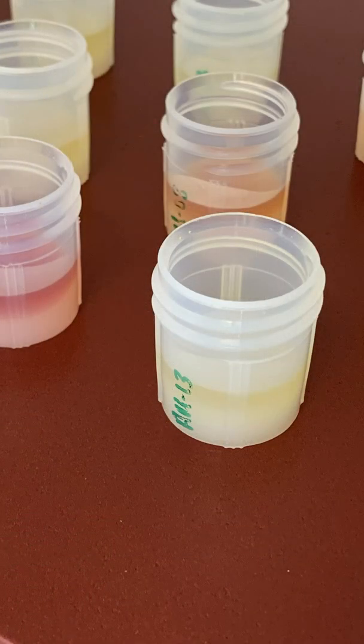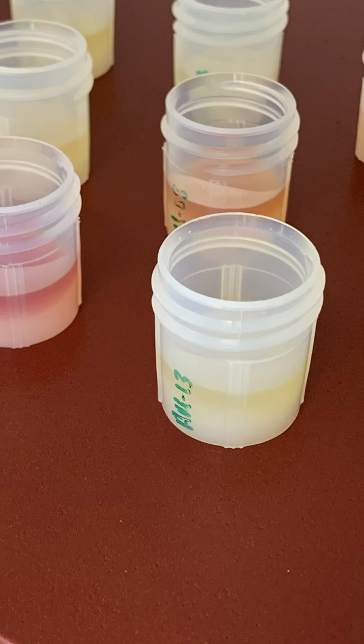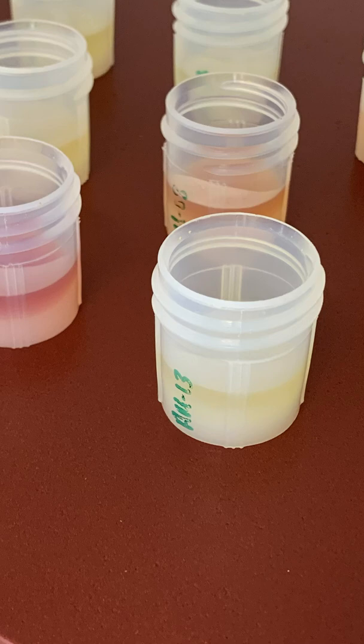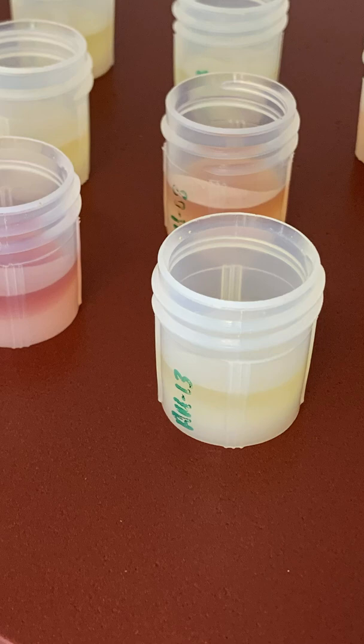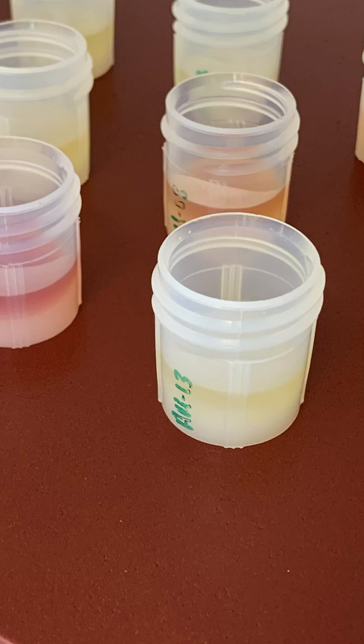Once the samples have the acid added to them, they then go on a special hot plate. This hot plate is actually made out of a teflon-coated block of graphite — the same thing that's in your lead pencils. The graphite allows for things to heat up at a really consistent temperature, and by adding heat to these samples, it helps us to break them down. We're going from incredibly hard solid materials, things like rocks and sometimes plants, into a pure liquid, which is really amazing.